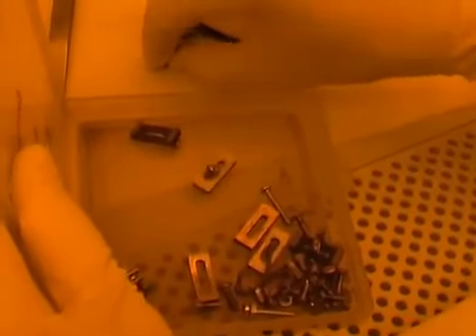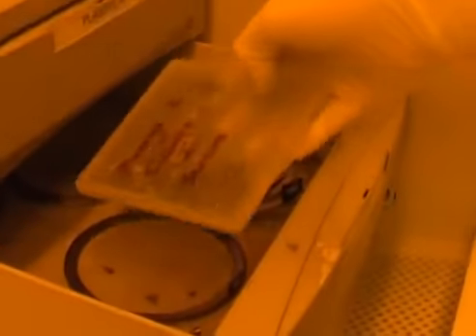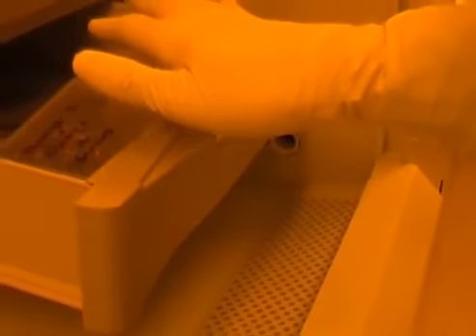In any case, I want to make sure that whichever option I choose, I leave both the box and the sample holder nice and tidy, and I put everything back.